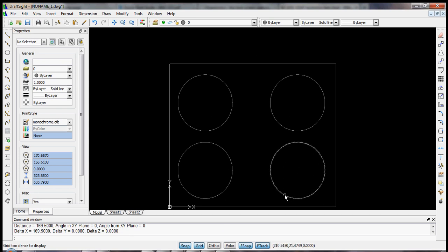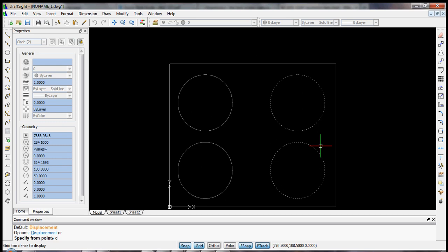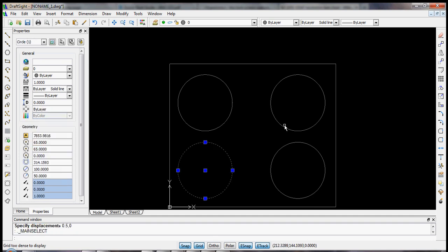Not a very round number, so let's move it over by half a millimeter, and then we can put our middle circle right in the center. Okay, let's move it by again hitting move, displacement D, enter, 0.5, 0, we'll move it over to the right half a millimeter. Couldn't even detect that. But now we know how to displace another unit.